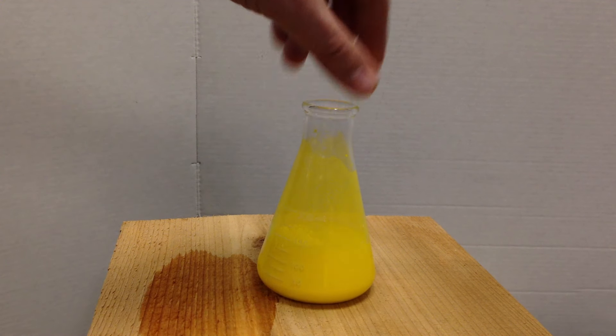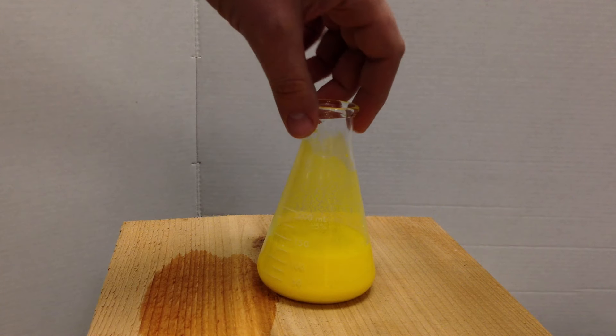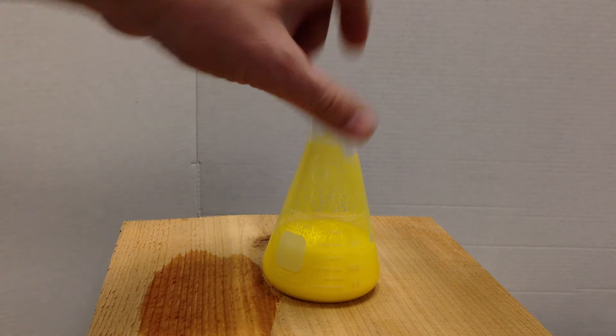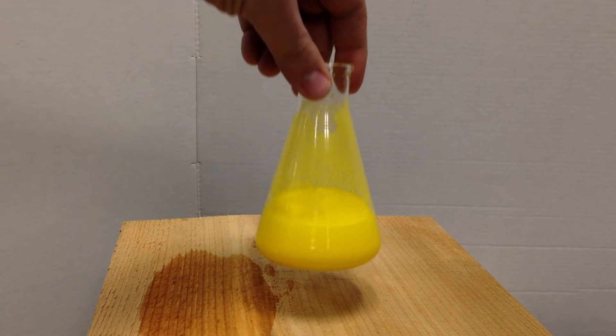A lot of yellow lead paints have been known to be yellow and also a problem. So there you go and there's your precipitate. And it's a precipitate because I know that I cannot see through the solution anymore.